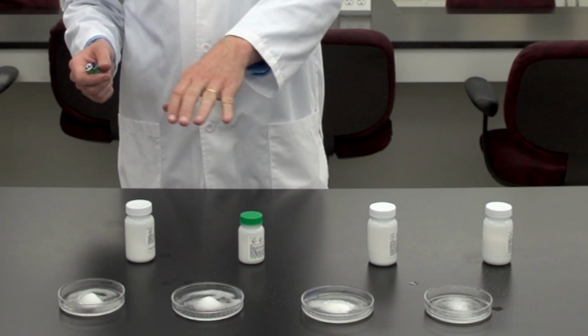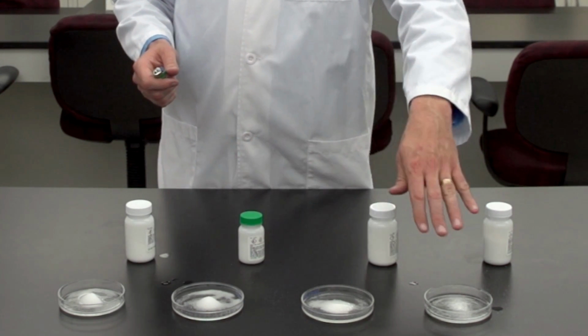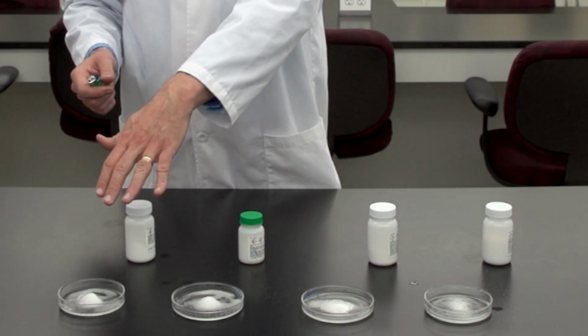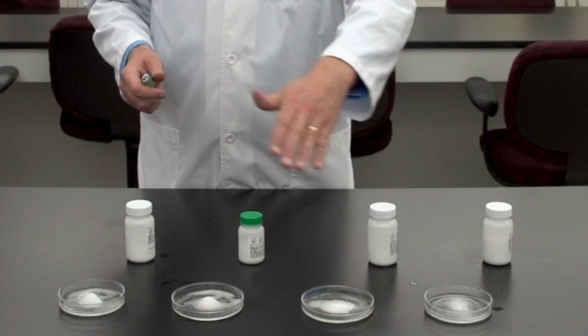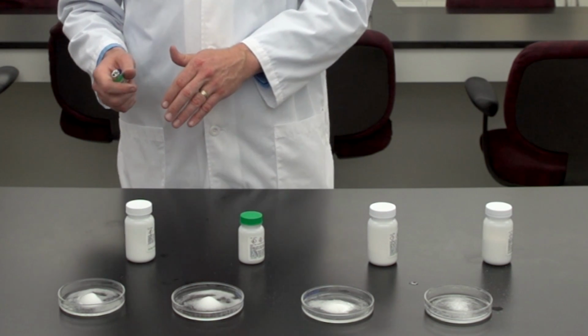We recognize that atoms of different elements have different properties. And one of the things we're going to do to look at those properties here is to take what's called a flame test. And what we have in each of these four dishes is a different metal salt. So the nonmetal that is with each of the metals here is chloride. So that is the same across all of these. And so the only thing we change across these four is the metal ion involved in the salt.